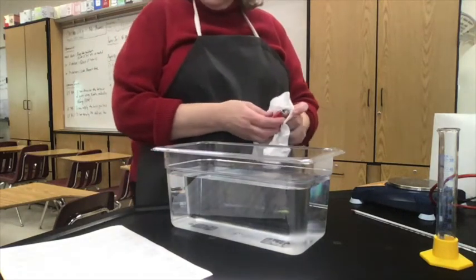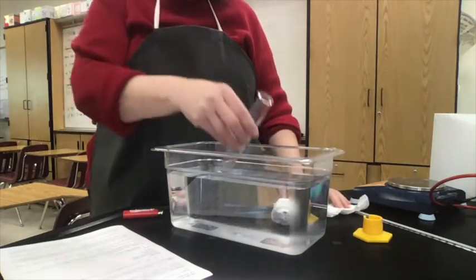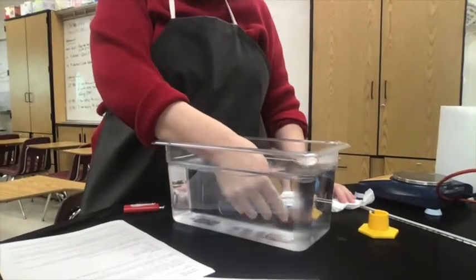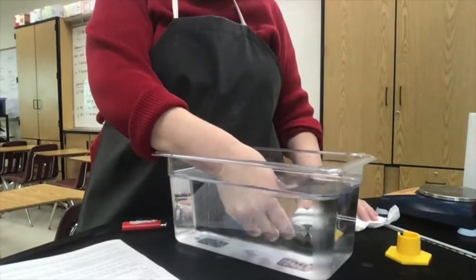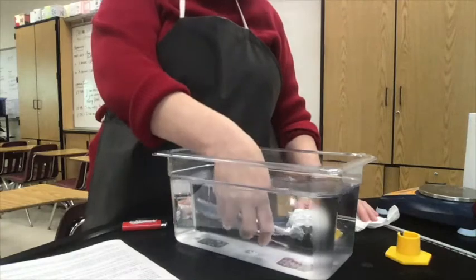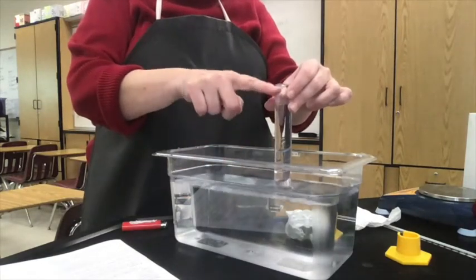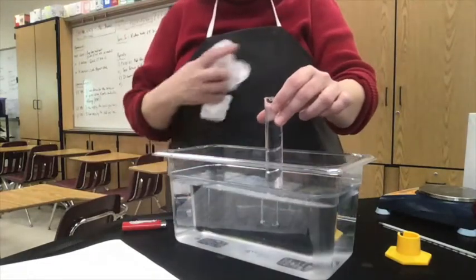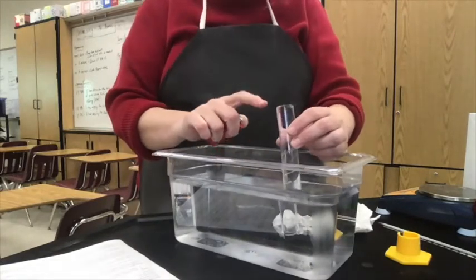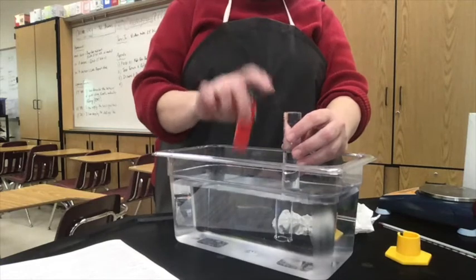Now I'm ready to do step three, where I'm going to take this graduated cylinder, take the bottom off of it just to make it easier to read, and dunk it in. I'm banging it to try to get rid of the air bubbles — it says be sure there are no air bubbles. Once we fill it with water, we invert it like this and we have a filled tube with water. When I bubble the gas from this butane lighter through it, it will displace that water.